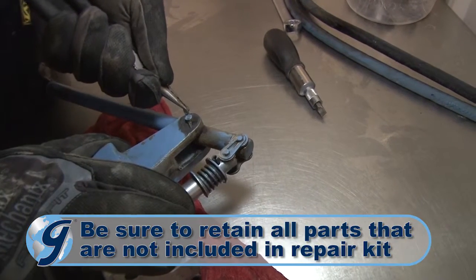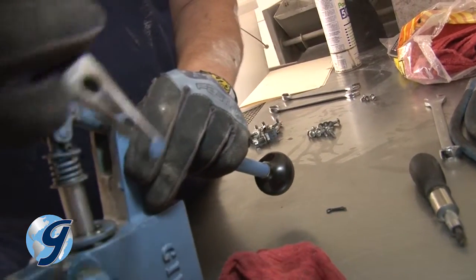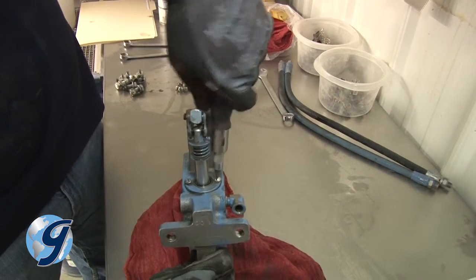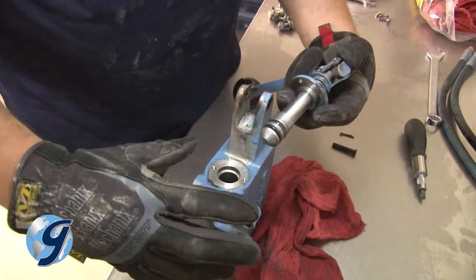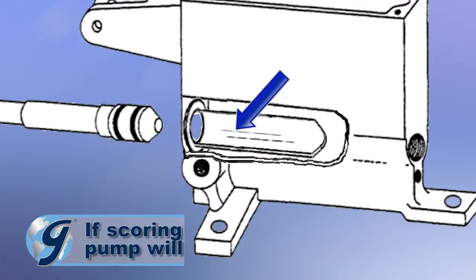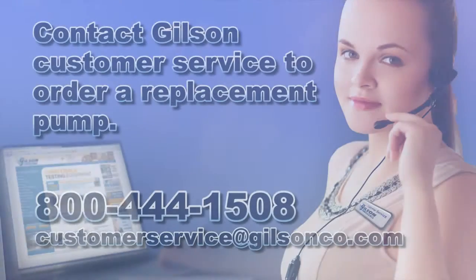Next, remove the cotter pin from the pump handle assembly and pull the pin. After the handle has been freed, take out the 2 screws from the plunger guide and seal. Now, remove the plunger from the pump body, and inspect the plunger and pump housing to make sure that there is no visible scoring. If scoring is evident, the entire pump will have to be replaced.